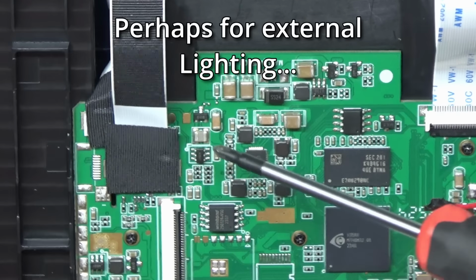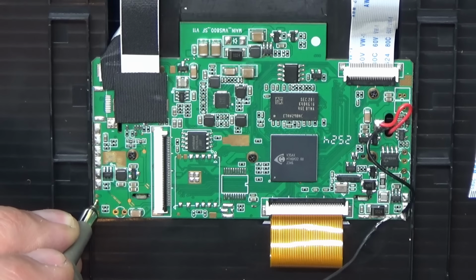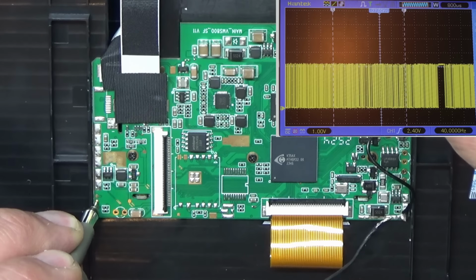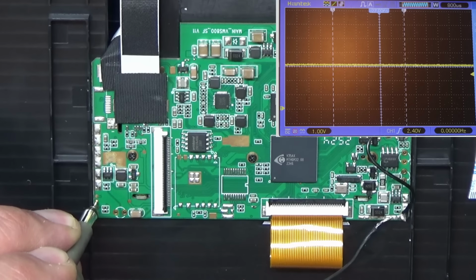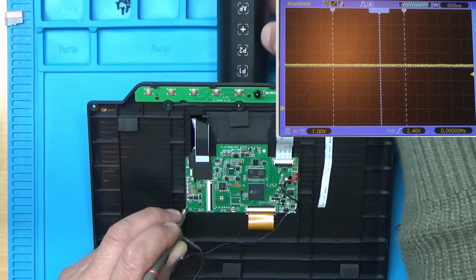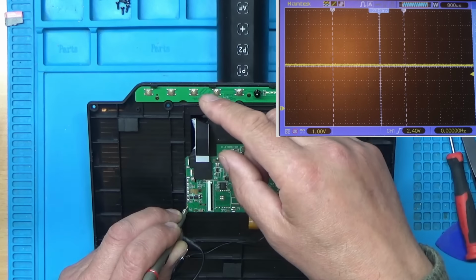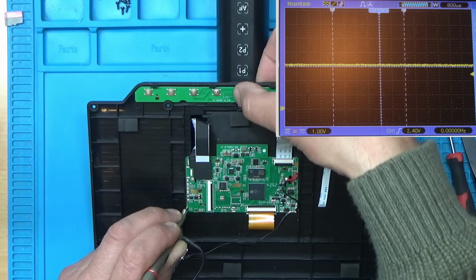So I couldn't resist having a bit of a poke on this connector here. I thought, well, is it a debug connector or not? I think it was this pin here that was the only one that you got a brief flash of data on, and literally that was it. Even if I zoom in and out here with the microscope, or I hit the auto focus button, we don't seem to get any more activity. So I would have thought we'd be getting some kind of debug messages on the scope here, but nothing, even when we switch it off.